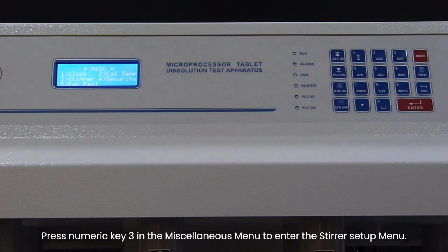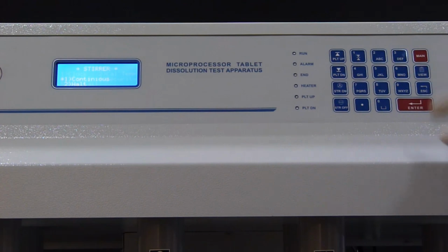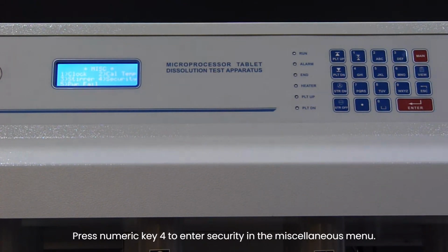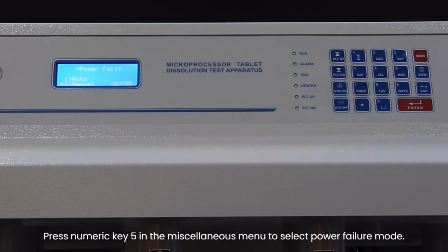Press numeric key 3 in the Miscellaneous menu to enter the stirrer setup menu. Press numeric key 4 to enter security in the Miscellaneous menu. Press numeric key 5 in the Miscellaneous menu to select power failure mode.